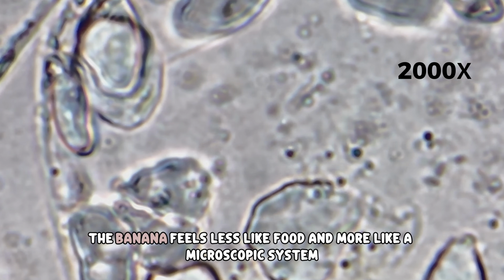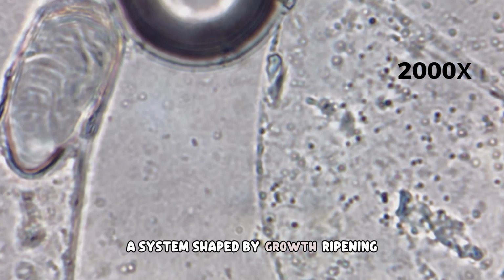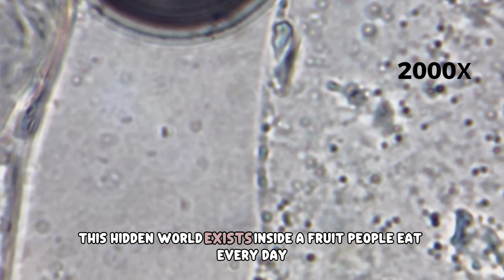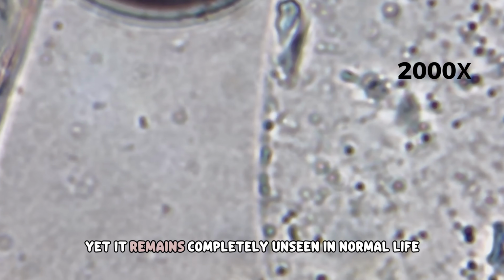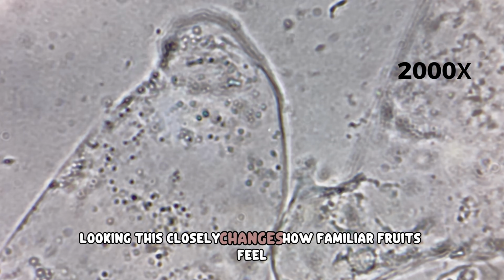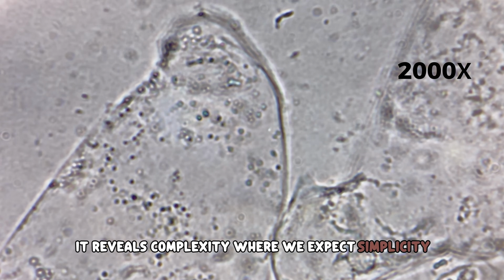At this level, the banana feels less like food and more like a microscopic system. A system shaped by growth, ripening, enzymatic activity, and time. This hidden world exists inside a fruit people eat every day, yet it remains completely unseen in normal life. Looking this closely changes how familiar fruits feel. It reveals complexity where we expect simplicity.